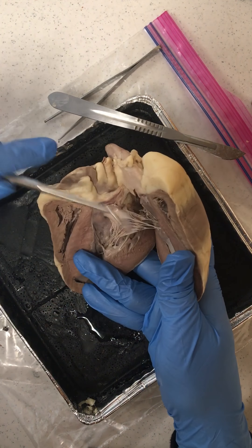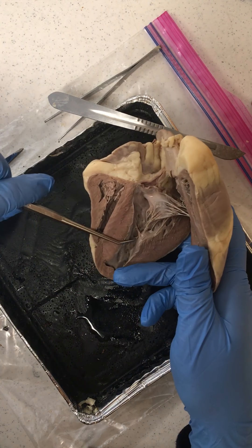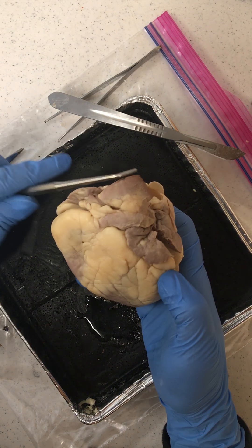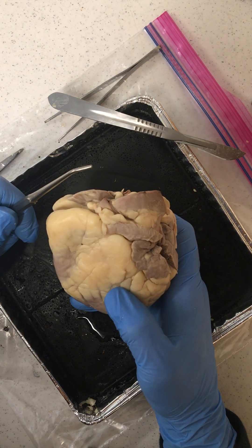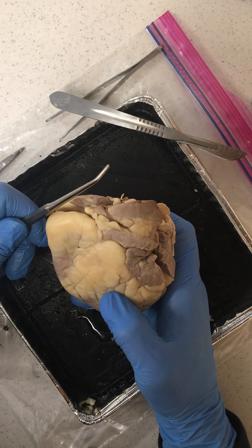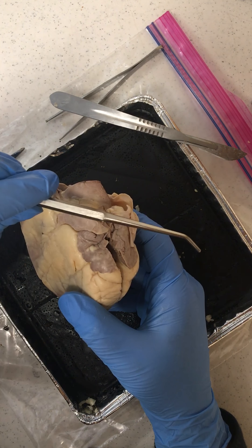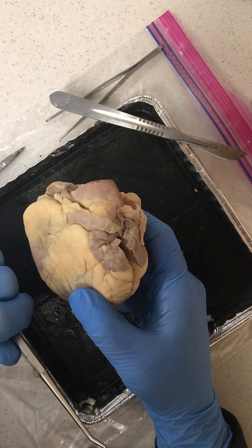Once in the left atria, the blood flows through the bicuspid valve — or the mitral valve — down into the left ventricle and out through the aorta. The aorta is the large artery that stems from the left ventricle and carries blood out to the systemic circulation. Off the aortic arch is the brachiocephalic trunk, which branches into the right subclavian artery and the right carotid artery to supply blood to the head and arms. On the left side of the aortic arch there is no brachiocephalic trunk, but rather the left subclavian artery and the left carotid artery.